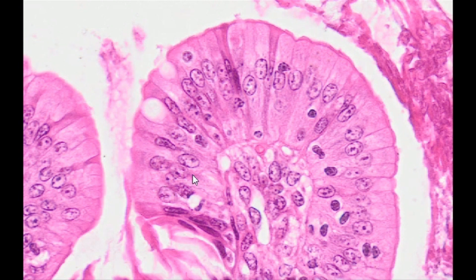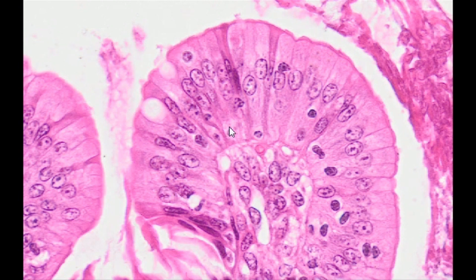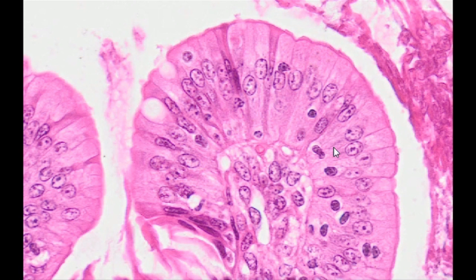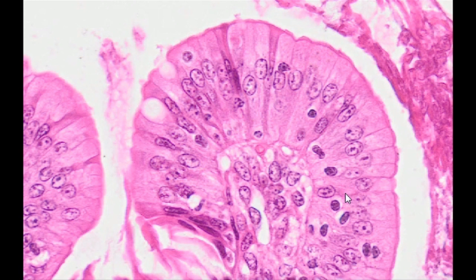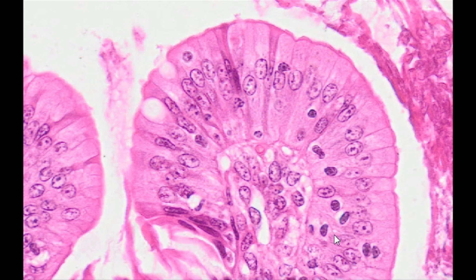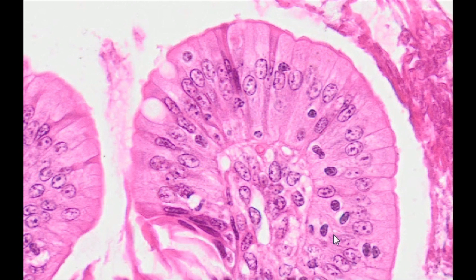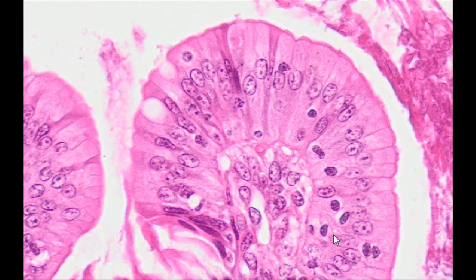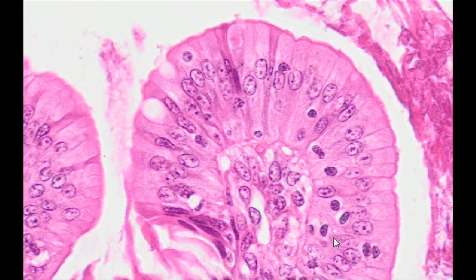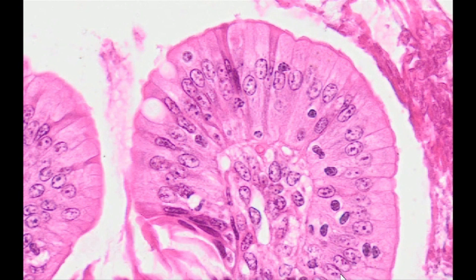The cells of this epithelium are closely adjacent. This is possible due to the presence of specific intercellular junctions that connect not only the cell membranes of neighboring cells, but also the elements of the cytoskeleton — intermediate filaments in particular.